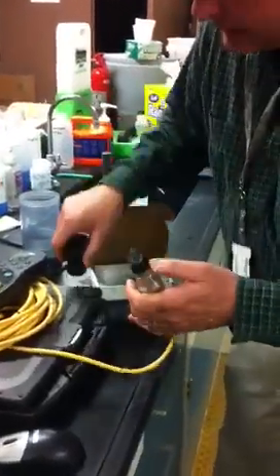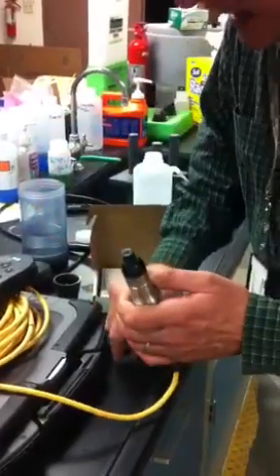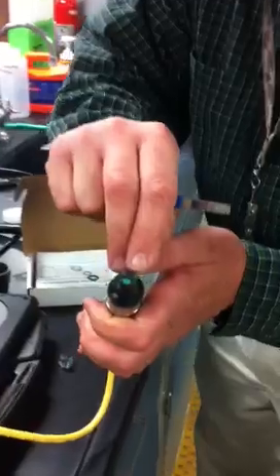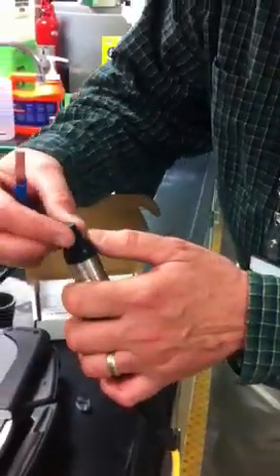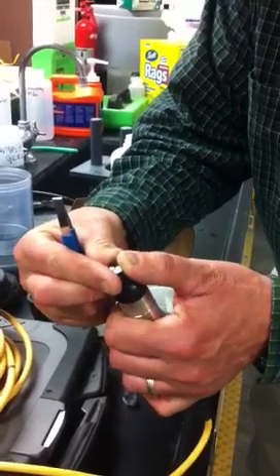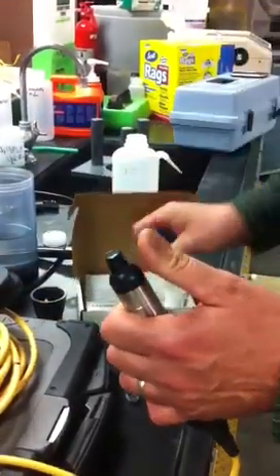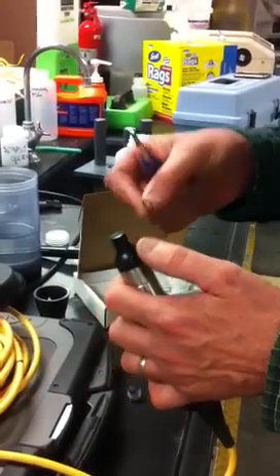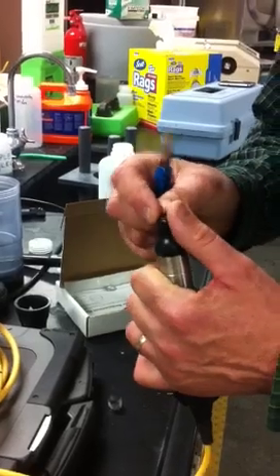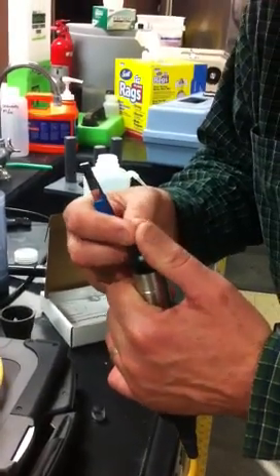pop your rugged cap off, remove the old cap, and on top of the lens is a little rubber seal that protects the cover. It seals the water out. Just maybe take your thumb and softly push it up so that rubber seal pops off just like that. And then you replace it the same way with the new one. And you try not to touch the glass. It just pops right on there. It's a little slot.